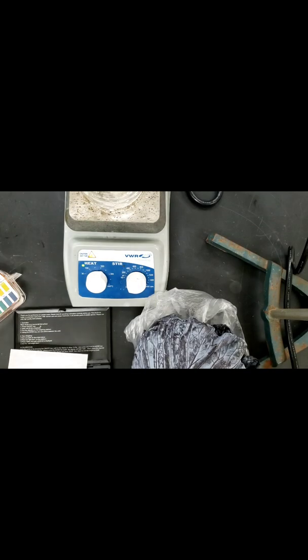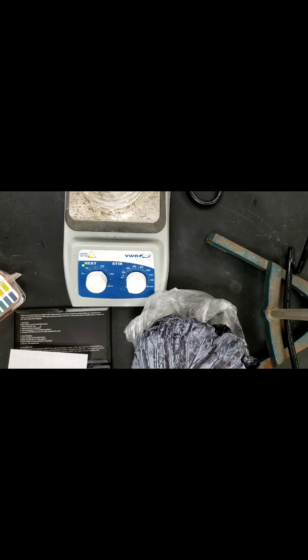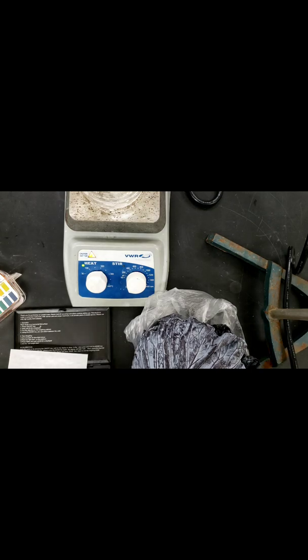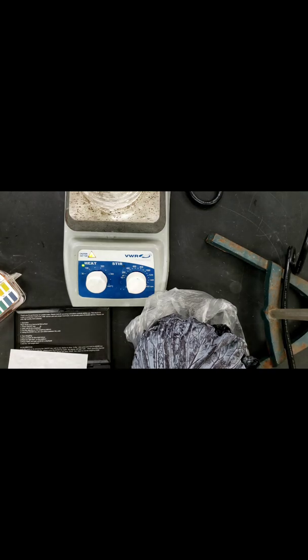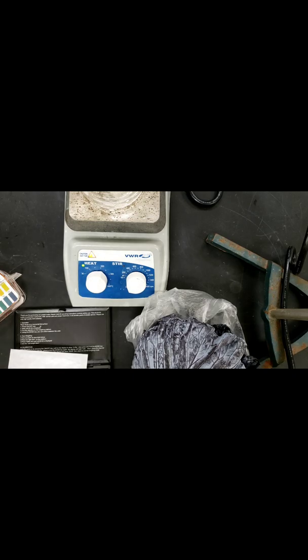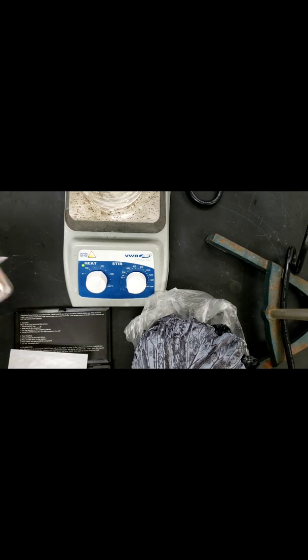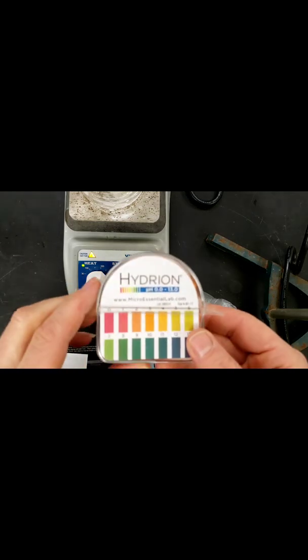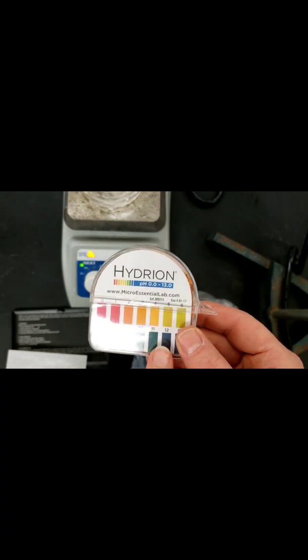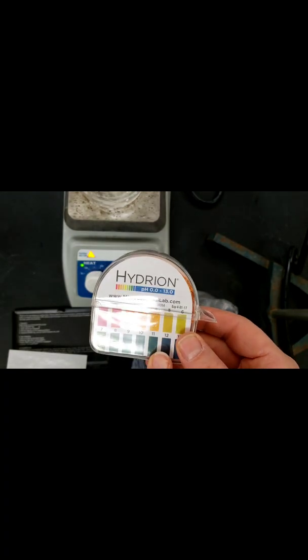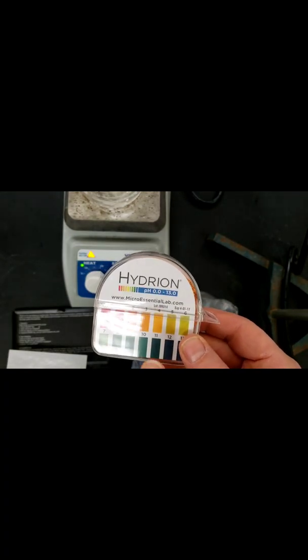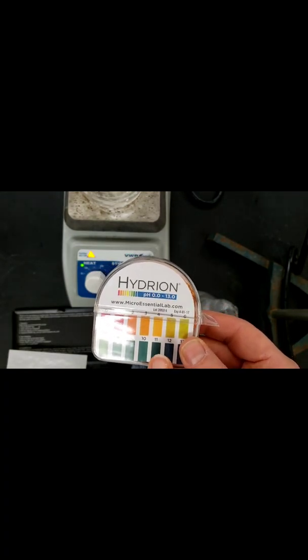The first way that we're going to do it is using pH paper. We're going to look at some different household chemicals, use pH paper that allows us to determine the pH.